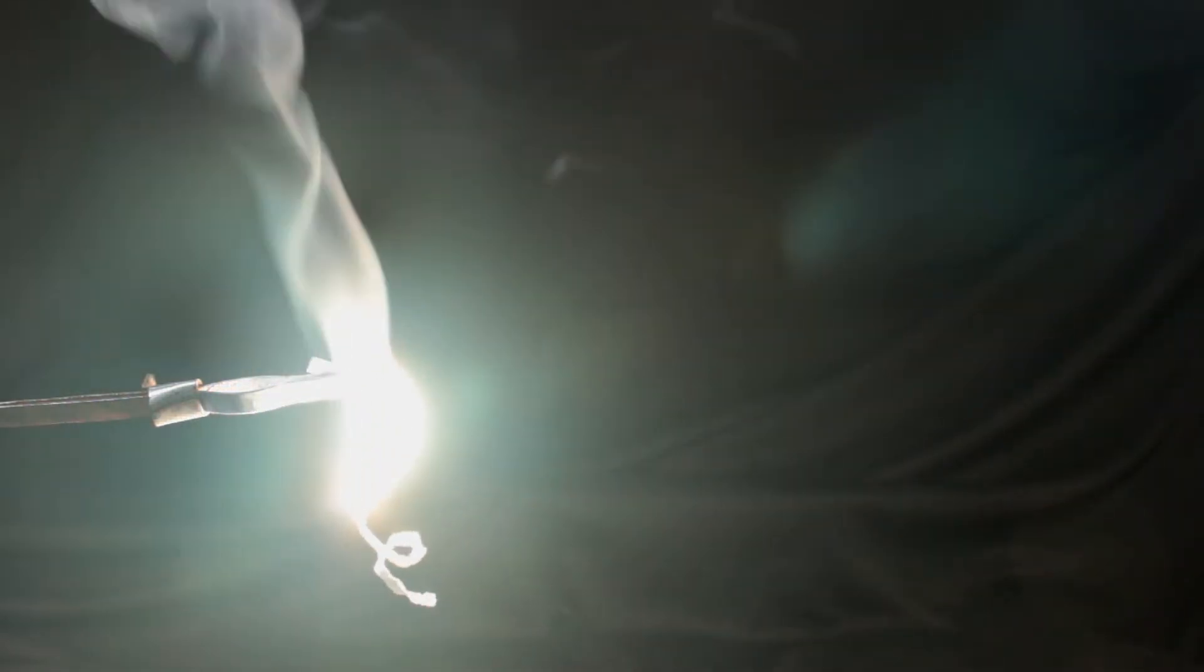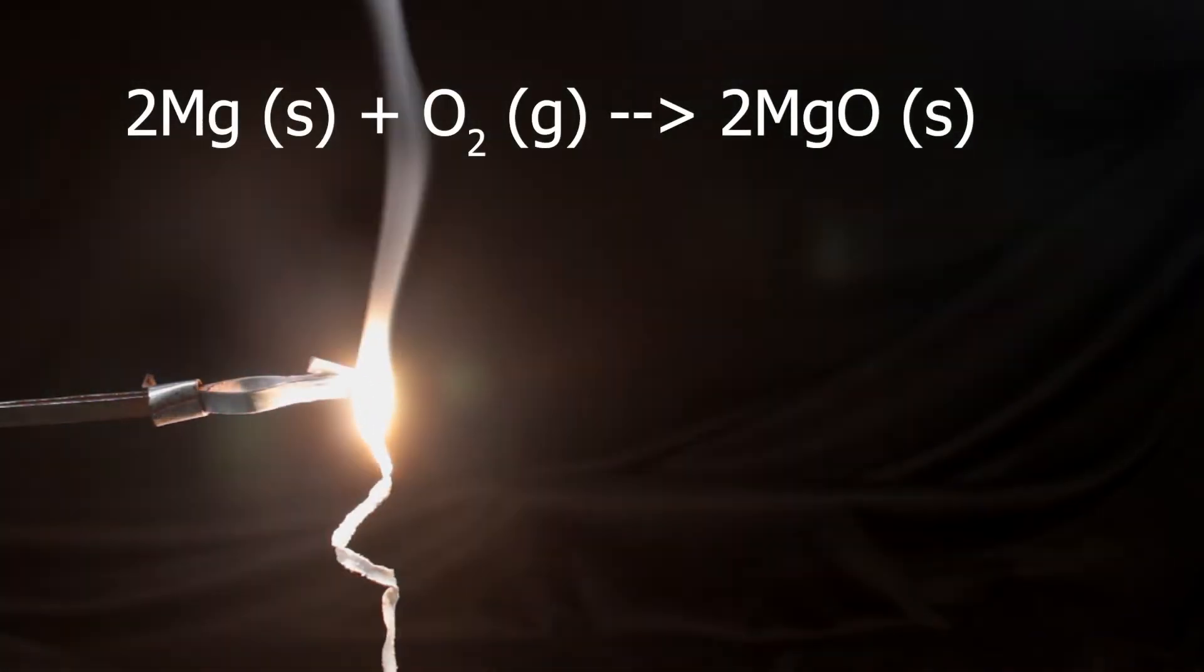White solid and white smoke is magnesium oxide. Here is the obvious equation for the reaction.